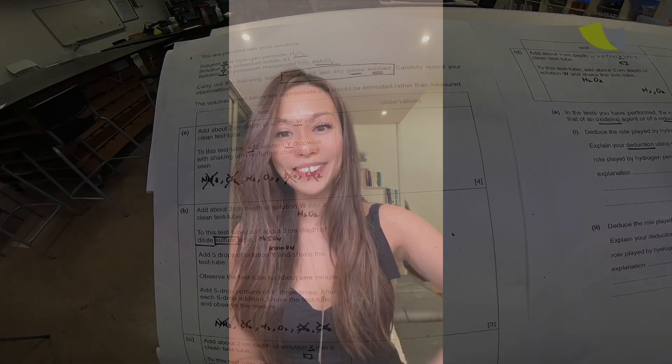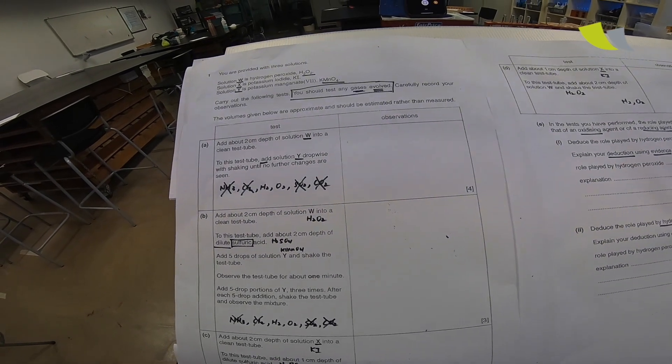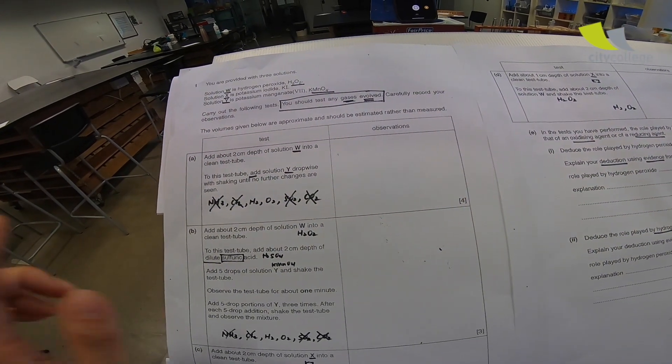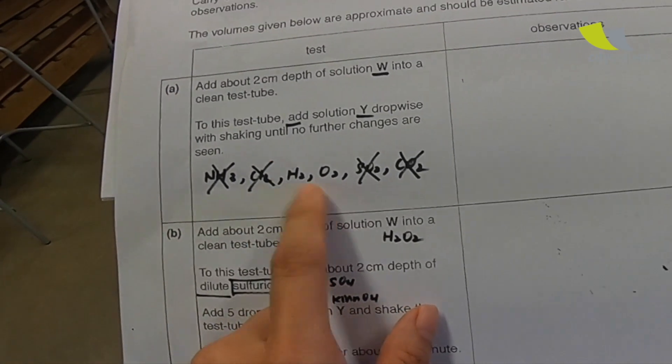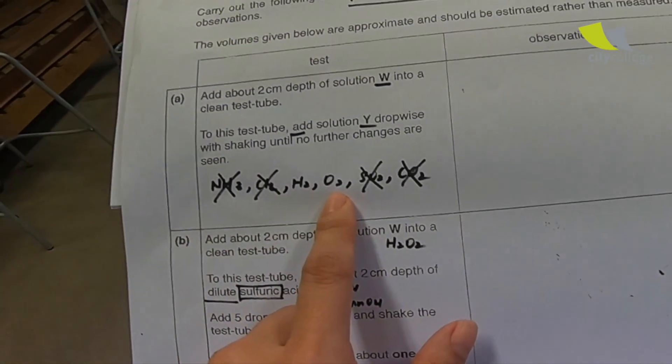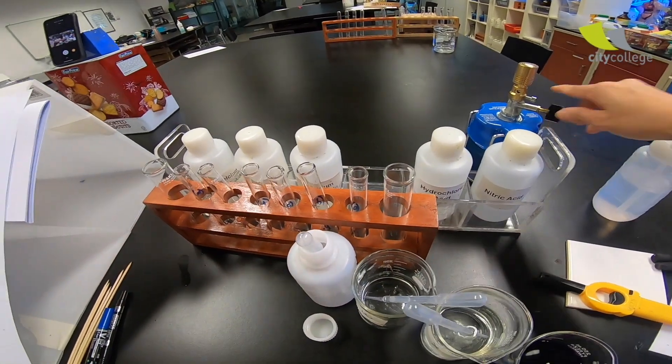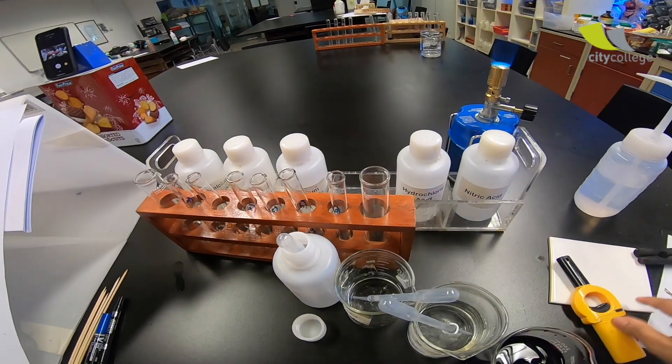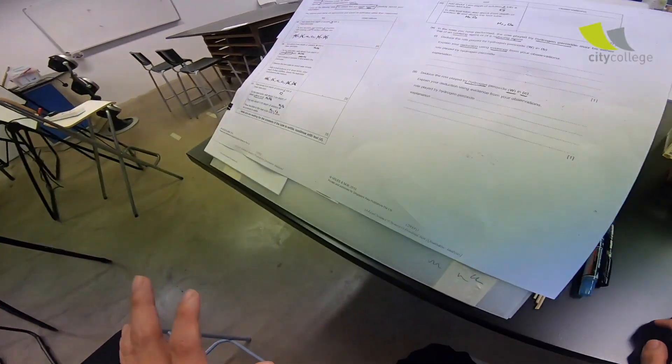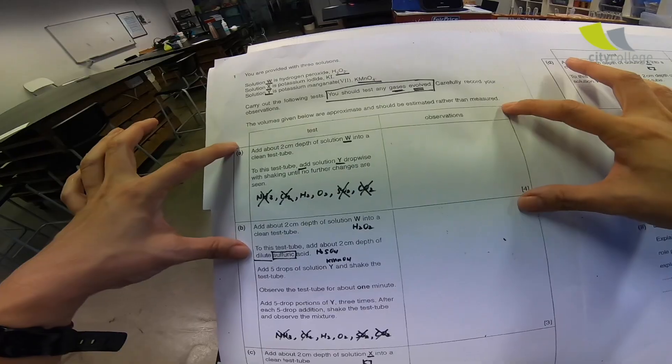And along the way, remember, this is about redox. So as you do, remind yourself what are the important things to observe. Are you ready? Let's begin. Now we are finished preparing, it's time to do our execution. However, before we start, let's remember that there are two important gases that we are testing here: hydrogen gas and oxygen gas. So we normally use a splint to test for this gas. So it's important that you test your Bunsen burner. It's working well. I light it up, leave it at the side and go back to our main focus over here.